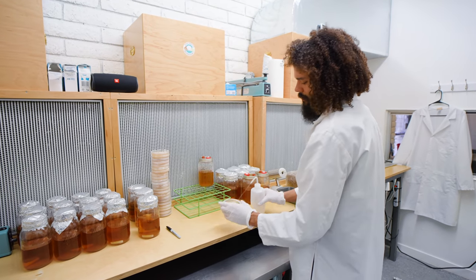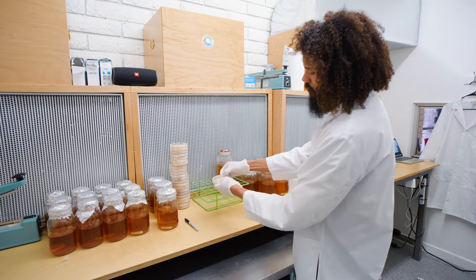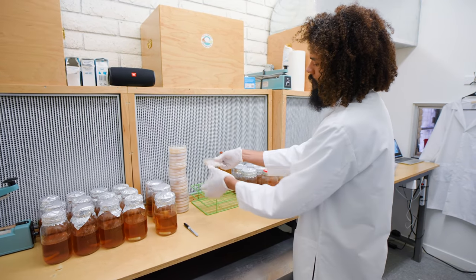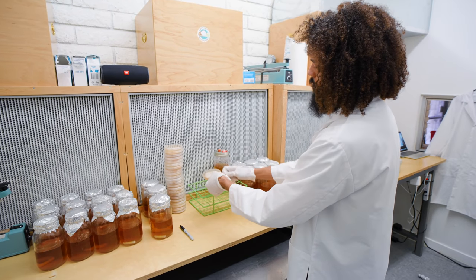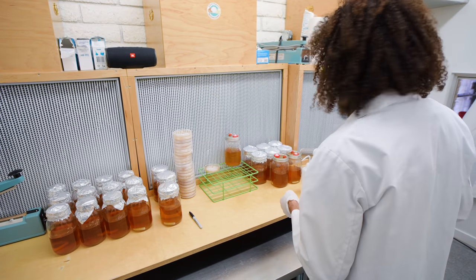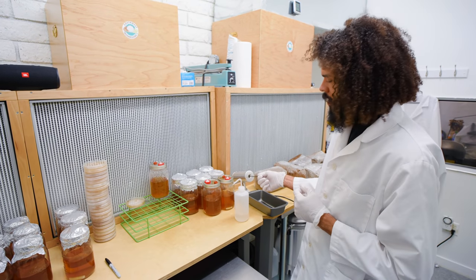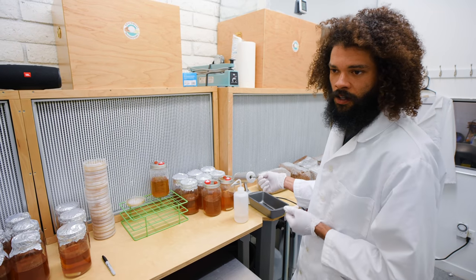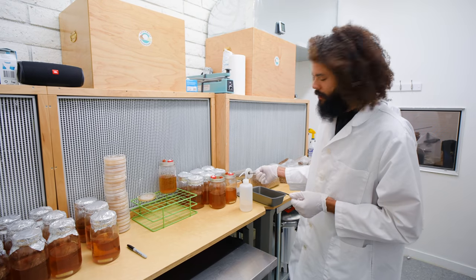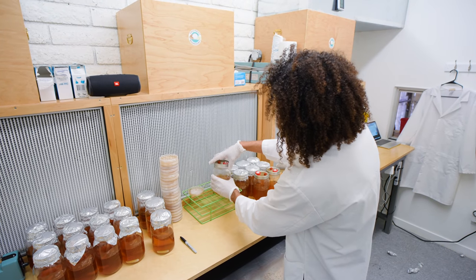I'll take the plate, throw some alcohol on it, make sure it's nice and clean, and then simply remove the parafilm. Just put it right in front of that HEPA filter. I'm going to heat up a scalpel to kill off any bacteria or anything we don't want making its way into our liquid culture — it would be a nightmare to ruin that. I also want to loosen up the lid.